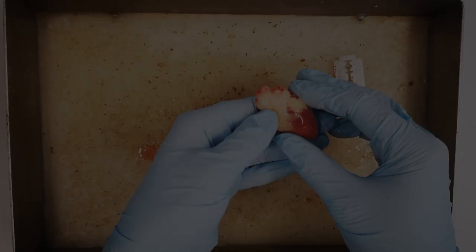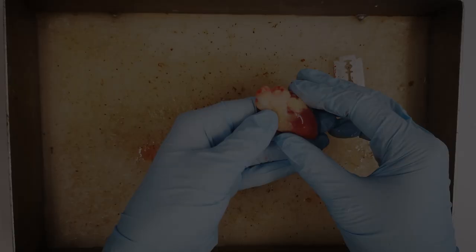With the second preparation object too, the heart is cut open in the frontal plane with a sharp new razor blade. Here we see that the anatomy of the chicken heart closely resembles that of the European quail, but is much larger.